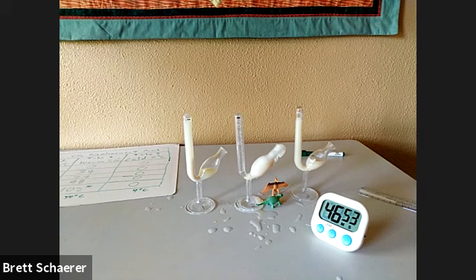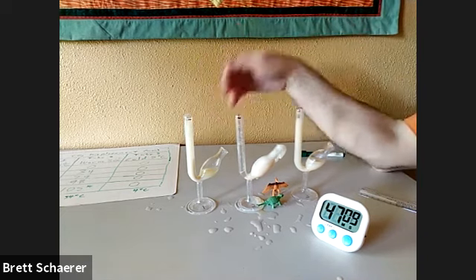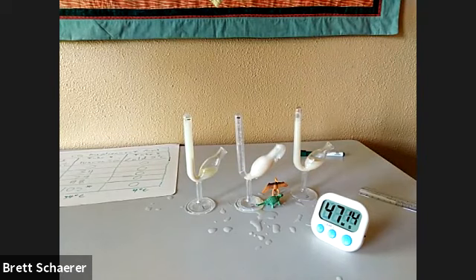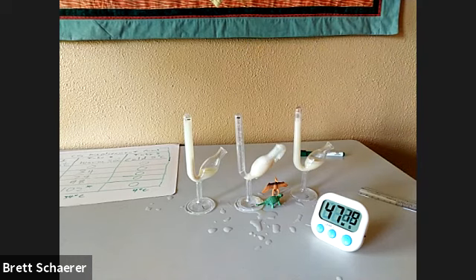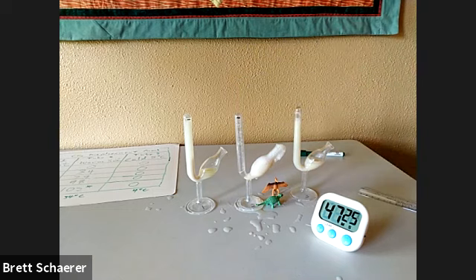All right, well, this concludes lab exercise 2 for lab 7, the fermentation lab. Ideally, we would have had replication. We would have had at least 3 of each of these tubes to get a sense of the variation between tubes in this environment and to make sure that it wasn't just a fluke that the results turned out this way. Unfortunately, I only have the 3 tubes, and so we kind of had to run this in not ideal conditions, and we're probably all used to not ideal circumstances by now.